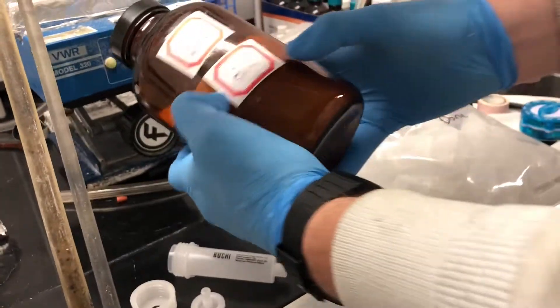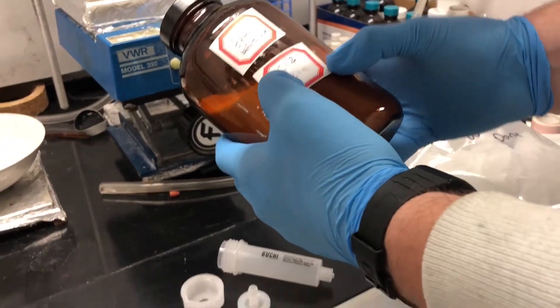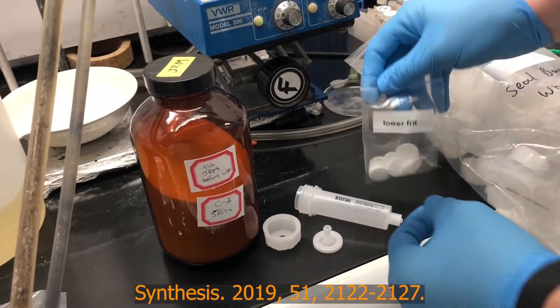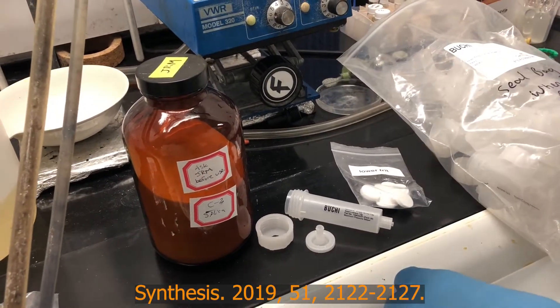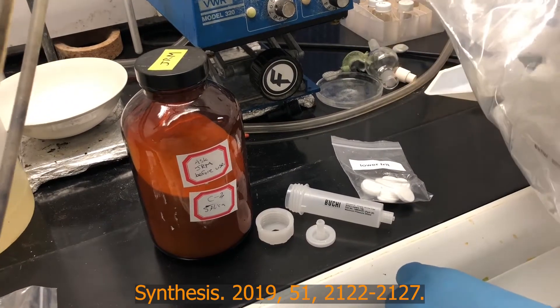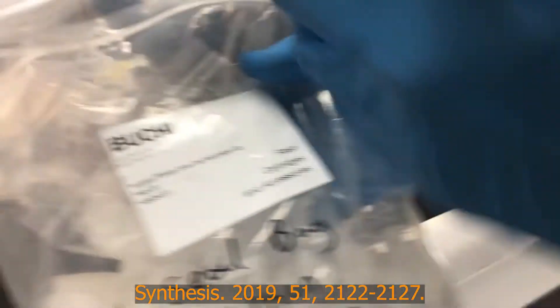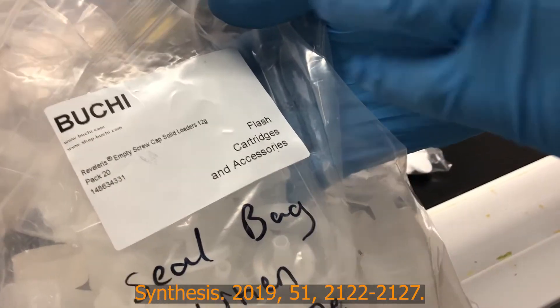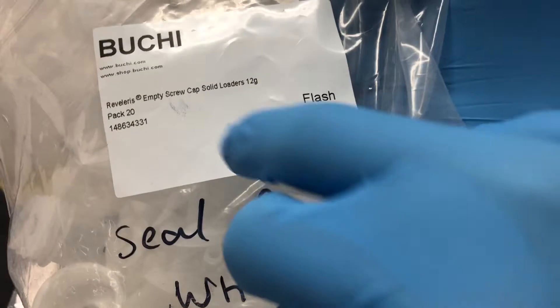We make our own C2 silica, which is ethyl activated silica gel. It's very simple to make, but we use that because we work with isocyanides, a chemical class that's very sensitive to silica gel. I'll link a paper down below to show you how C2 silica works, but this is what we're going to be using.